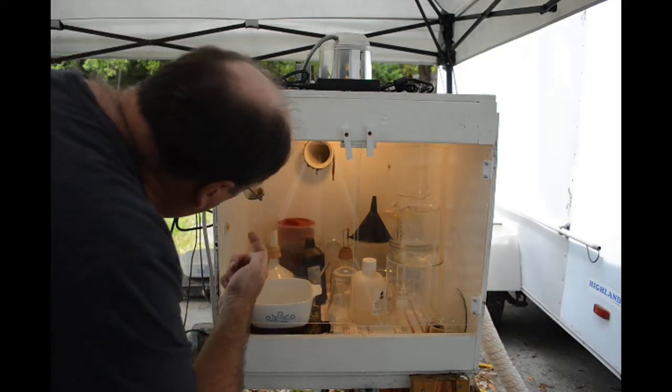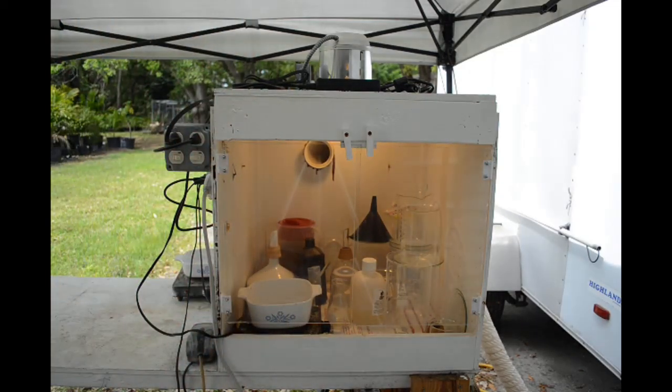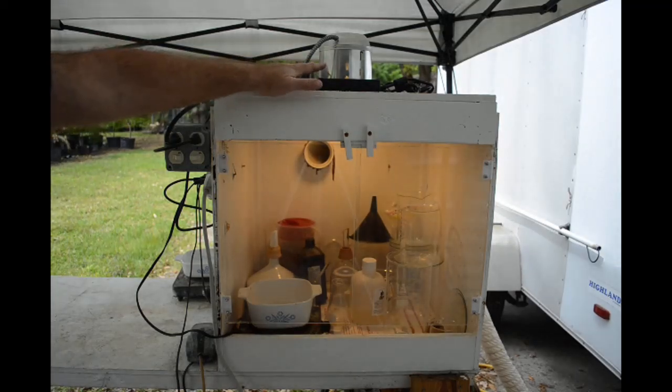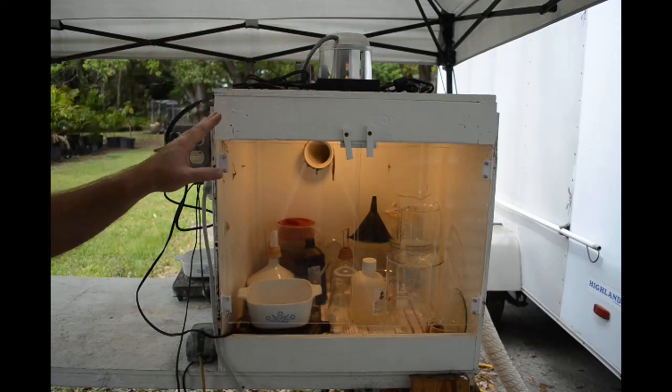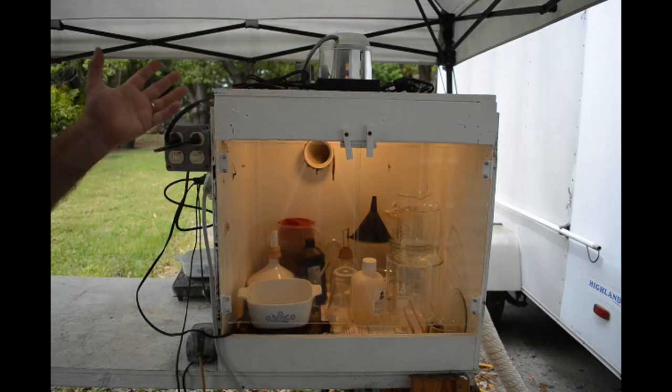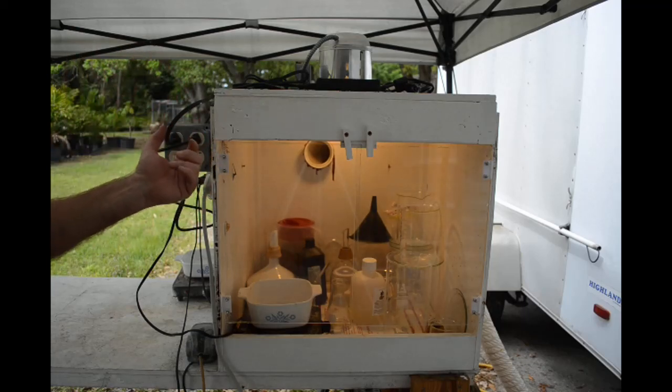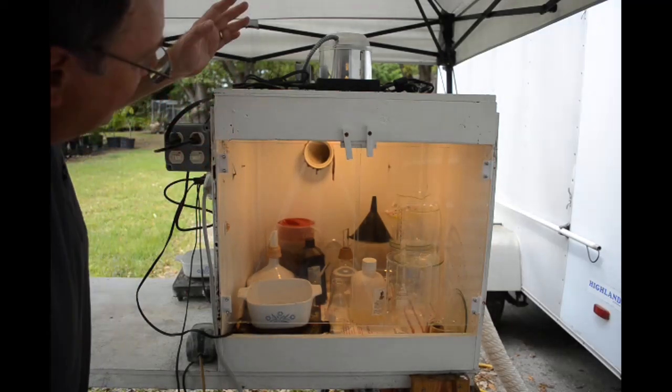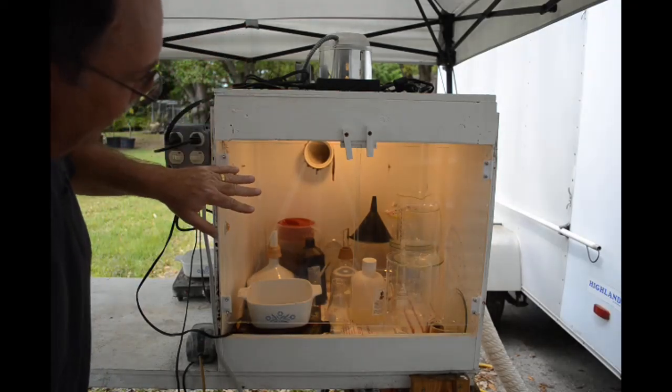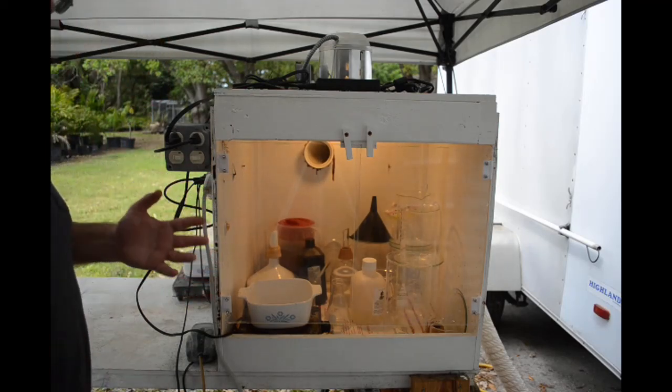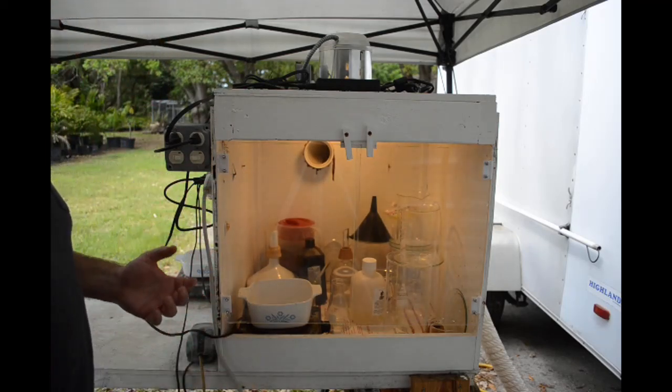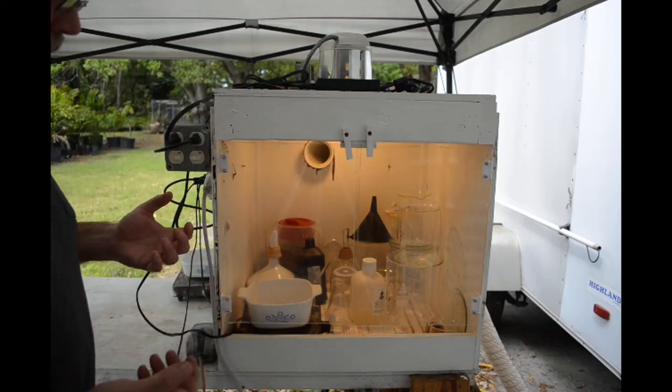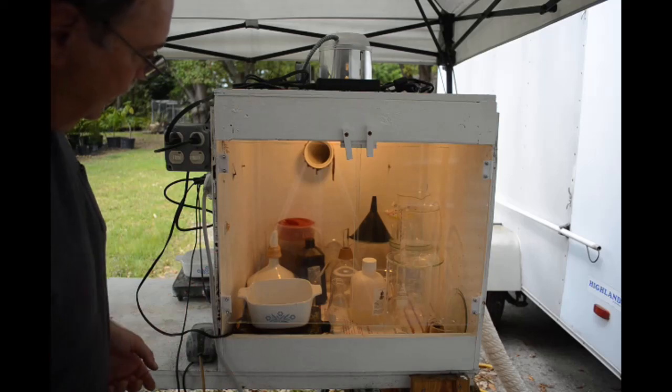The lighting issue - I didn't know what to do with lights because I figured any kind of light I put in here is going to be rapidly destroyed by the fumes, same as the original lights and blower were. So I figured I'm going to have to completely isolate the light from the inside of the fume hood.